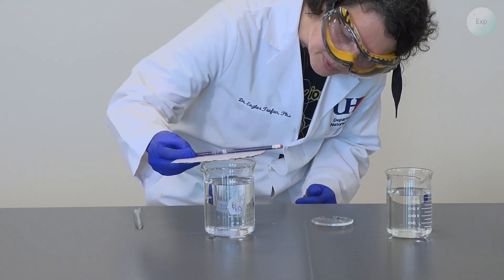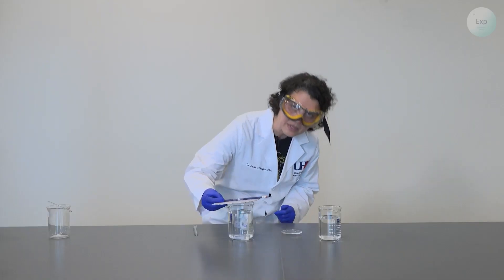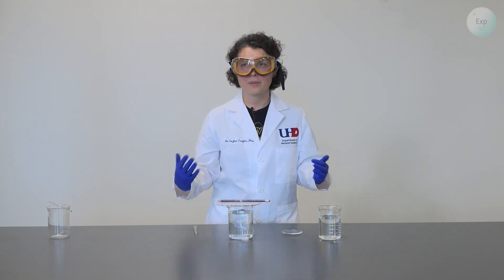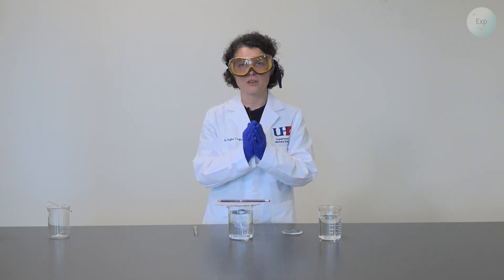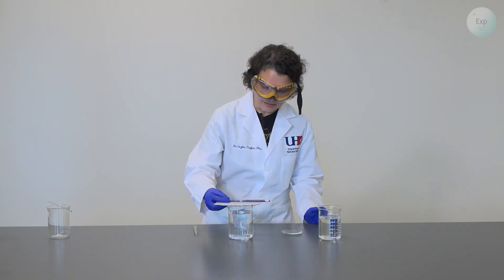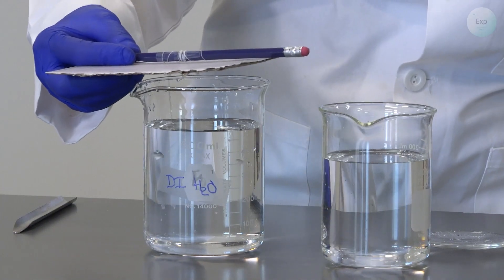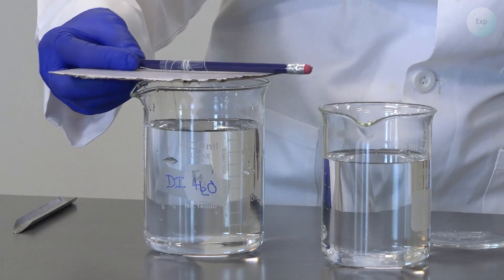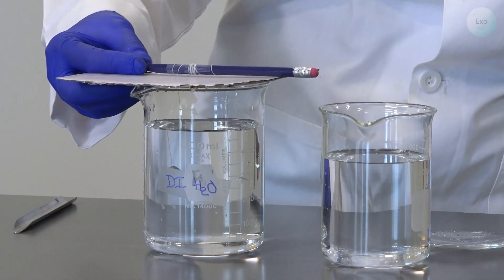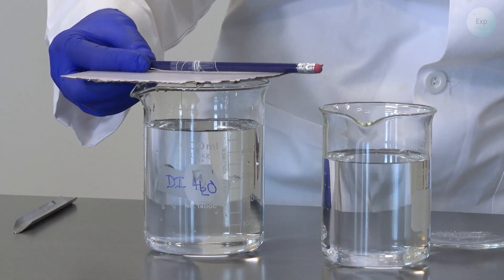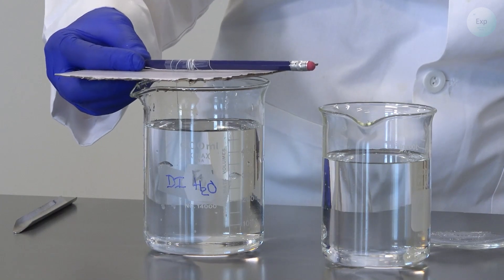And then it is a good idea to keep it there for at least 30 seconds to a minute. At this point, you're not worried about the crystals falling off because the thread has been completely integrated inside the crystal. And when you are done with the rinsing of your crystals, then very quickly you will move your crystals into the grow solution again.